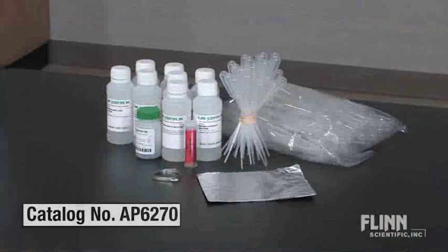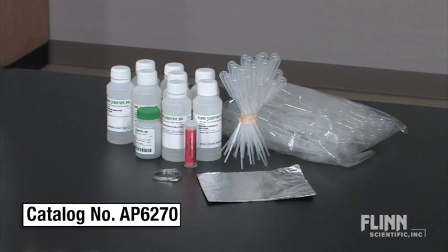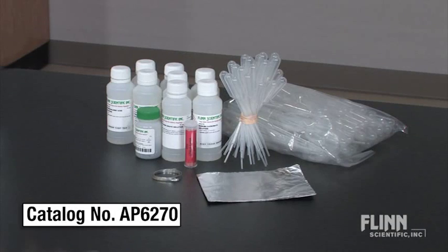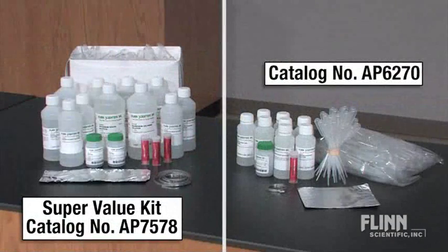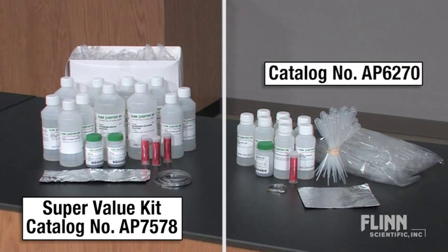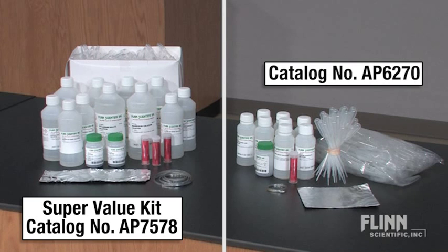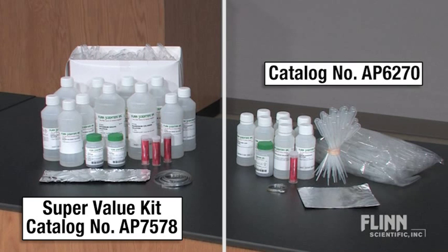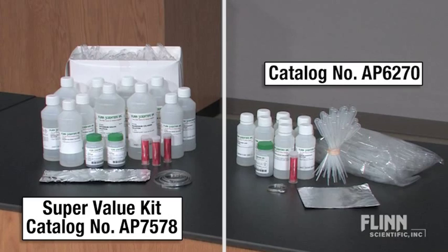The student laboratory kit includes enough supplies for 30 students working in pairs. There is also a super value kit available that has enough chemicals for five classes of 30 students working in pairs.